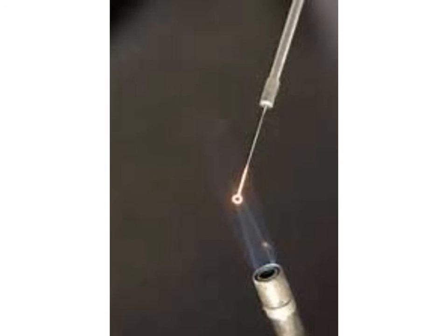We want to do this with either a Bunsen burner, or if your lab has a bacteria incinerator, you can hold it in that bacteria incinerator. Hold it in the flame until it's nice and red, or in the bacteria incinerator for a good five to seven seconds.